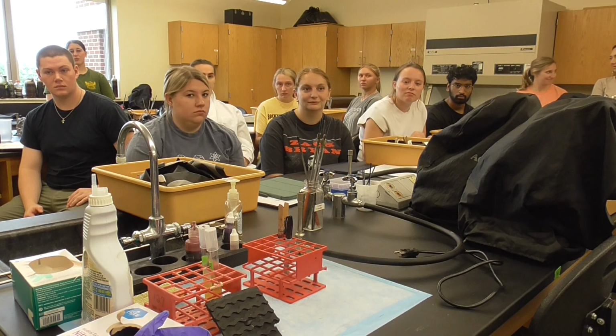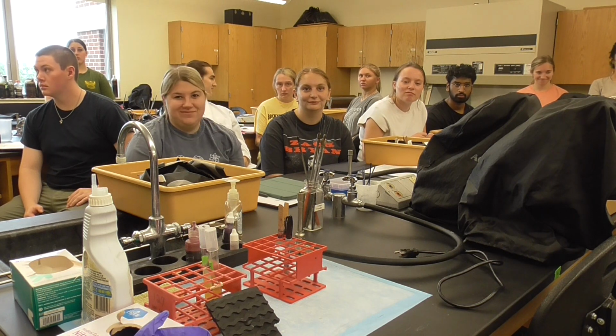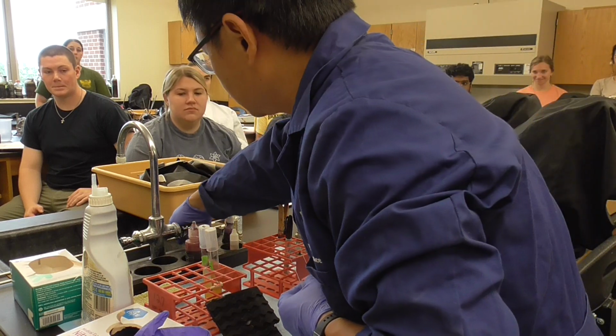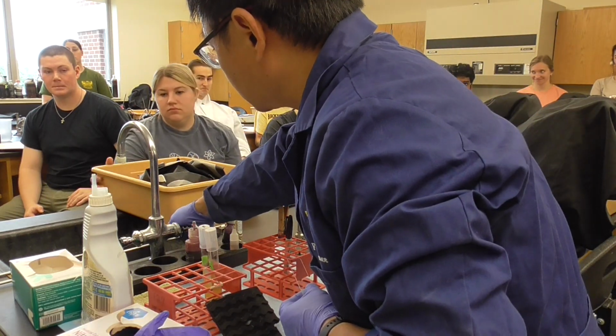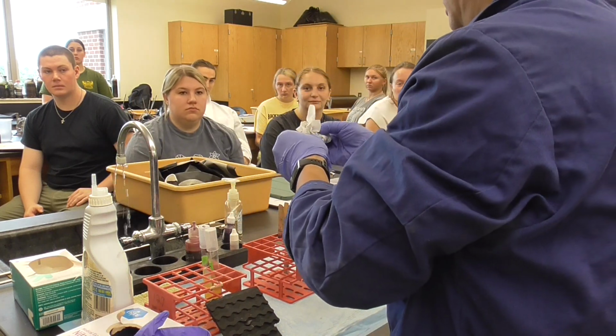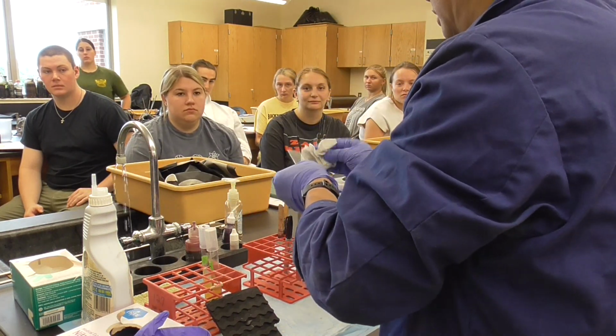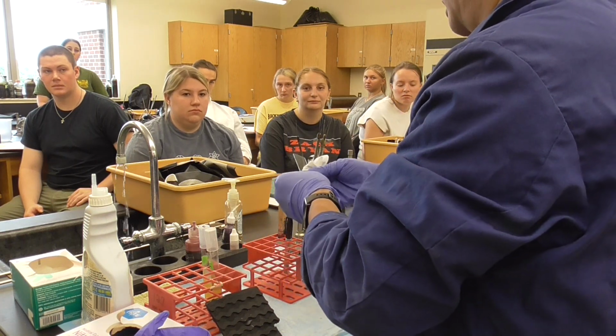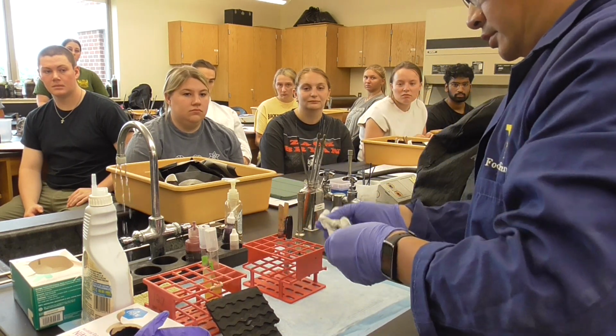Right here? Okay. Thank you. Usually if you see it's not clean, then use alcohol. I'll just use a paper towel to clean it. If you see it's already clean, then you don't have to do it.